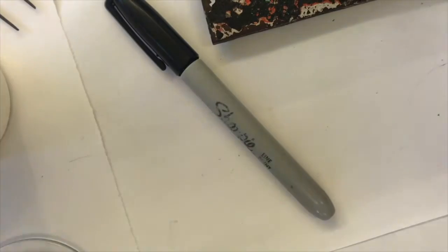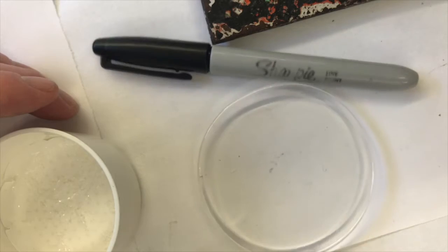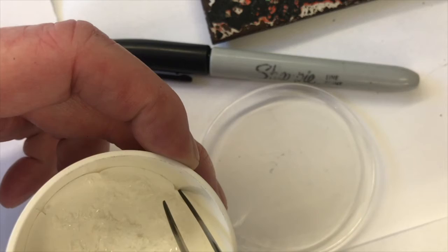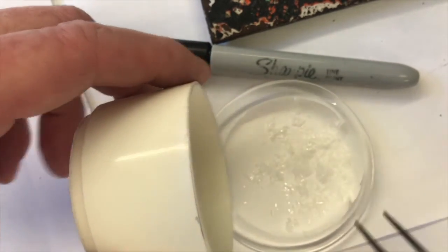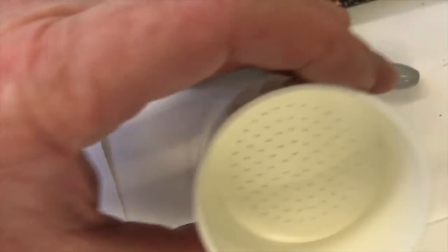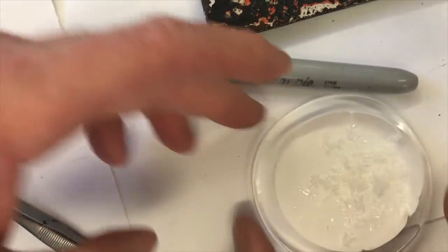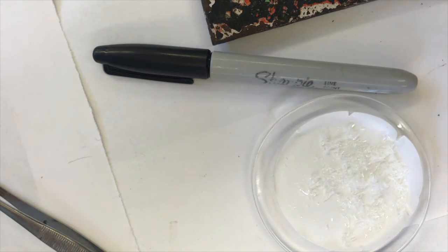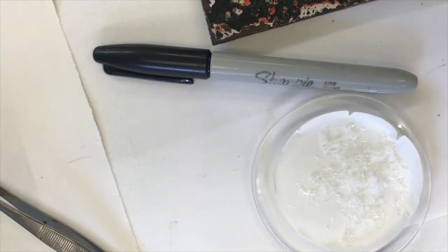Let's go this way. So I'm going to carefully take the filter paper out of the Buchner funnel top. Looking pretty dry already. Yeah, I think I got enough of it out. And I'll let that air dry. I don't even have to let it air dry very long, I think, maybe about 10 minutes. And I'll be able to get the weight of it, the IR, and the NMR. That's the nice thing about methanol, such a low boiling point solvent. It can be used quickly.